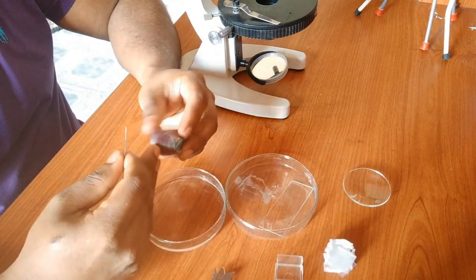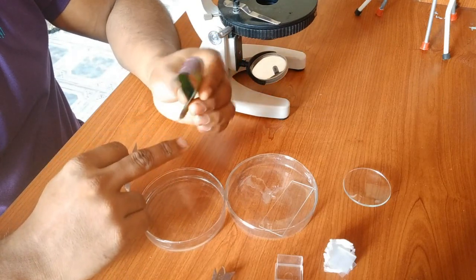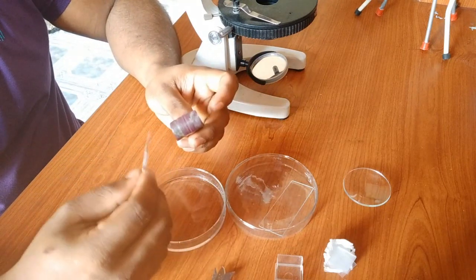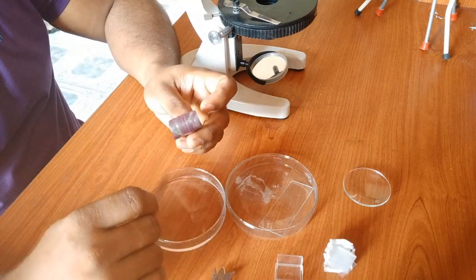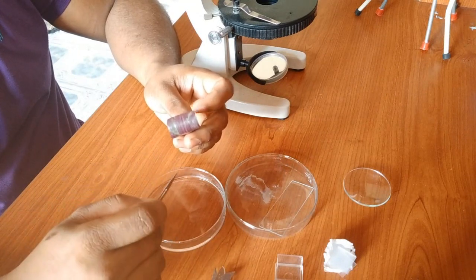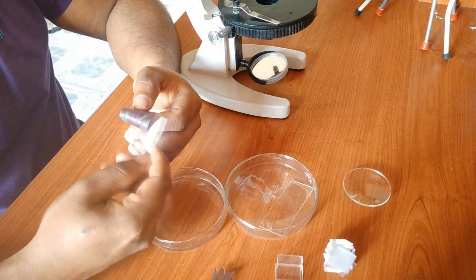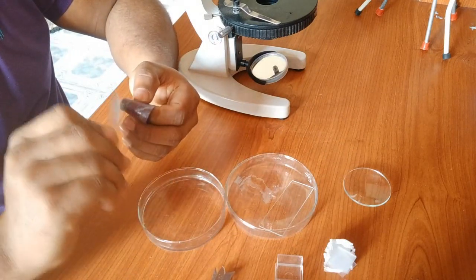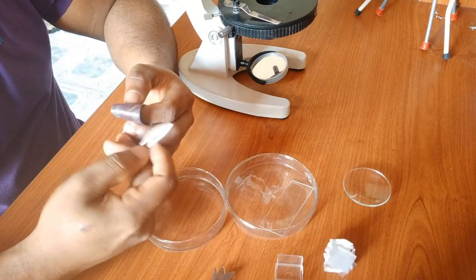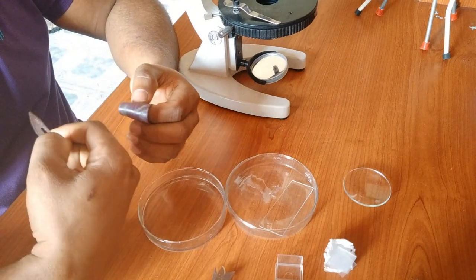So let's see how we take the cut. You can turn this leaf a little to make a curvature like this. Then you can take a thin specimen. So specimen should be very thin, otherwise so many layers of cells will cause transfer of light, so you can't see the cells clearly. So what you're going to do here, you can see. And the other thing, you are not cutting the specimen towards outwards, you're cutting the specimen towards yourself, then you can control your hand, because the hand is moving up to a certain limit.